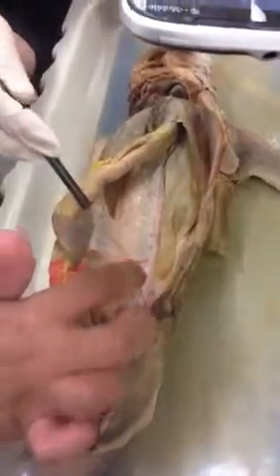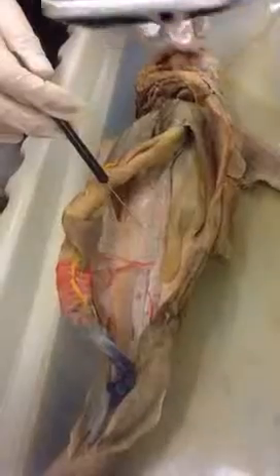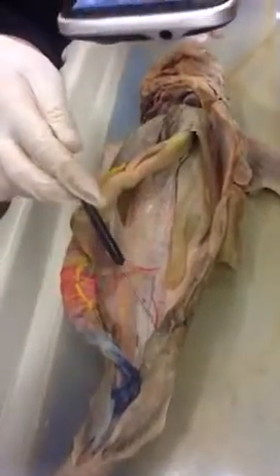That's your gastrosplenic artery. So it crosses over, and then the ones going down to the intestine, it's best to pull it. That's your posterior intestinal artery, and the one after is your gastrosplenic because it goes into your spleen. And this one is your posterior mesenteric artery, which hooks up with your rectal gland.